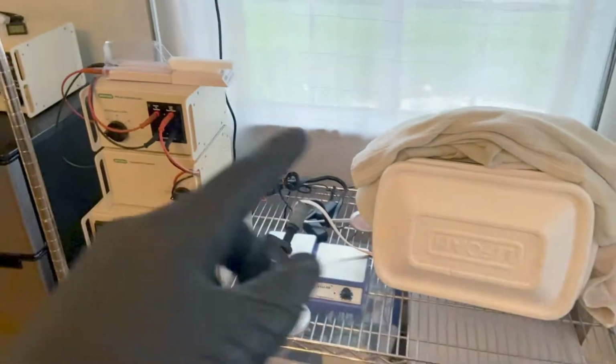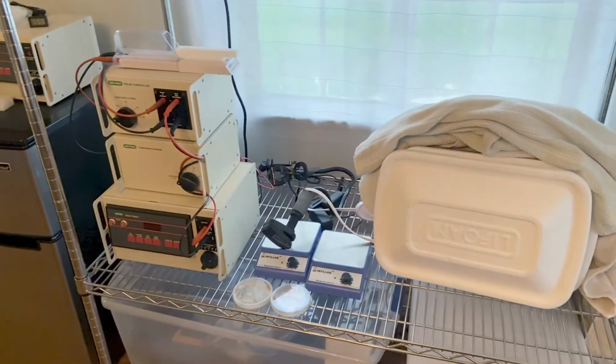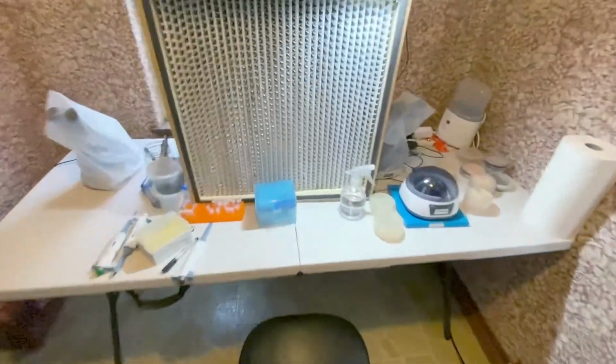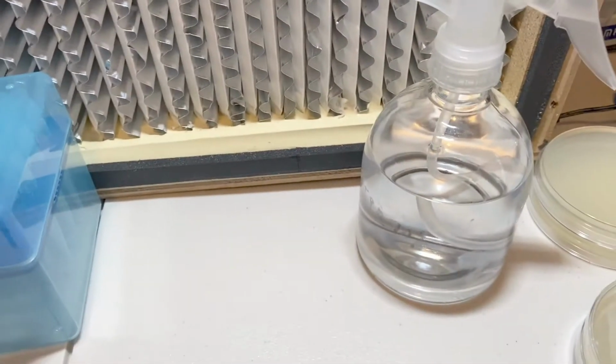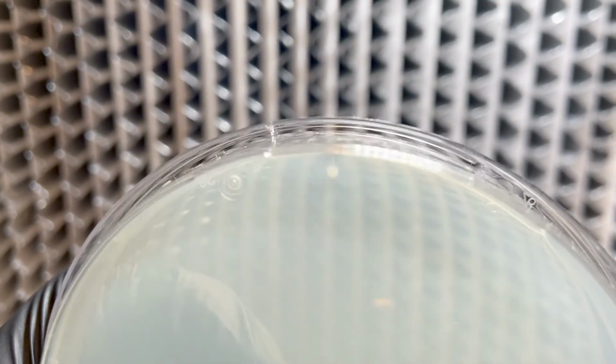Now we're trying to make sure that I can get some good transformants on the plate so that we can move on. And one of the things that has happened a couple of times, and has happened with my most recent run, is I'm not getting any transformants directly on the middle of the plate. I'm actually seeing them along the edges. I don't know if you can see on this particular one, but there's a single colony right along the edge.